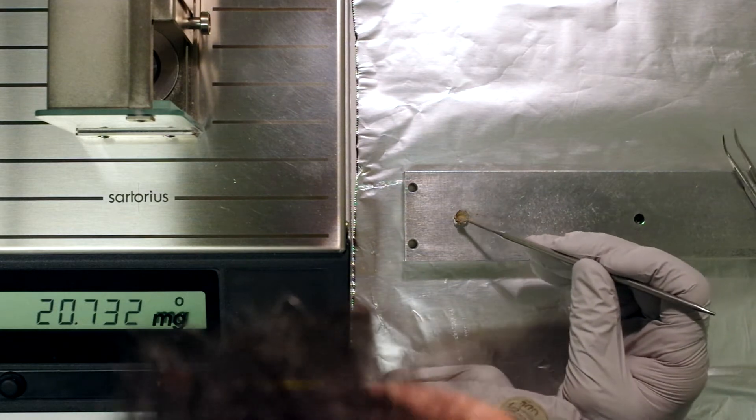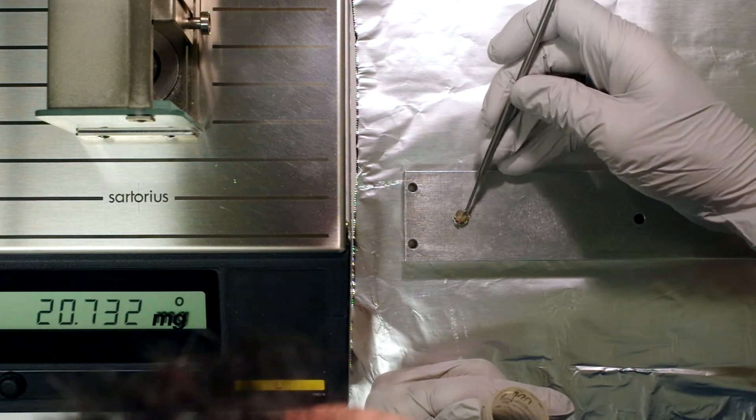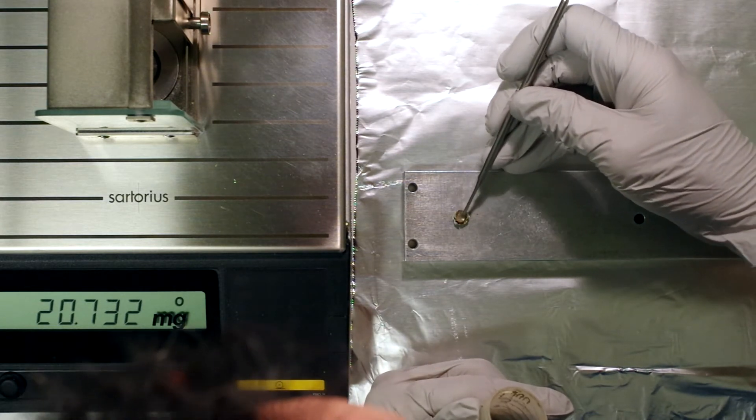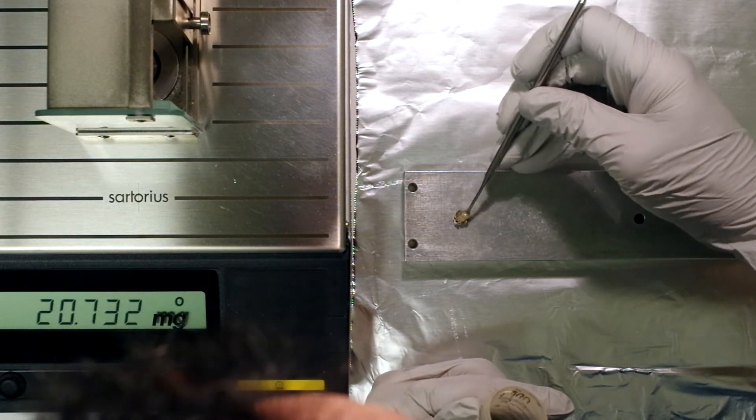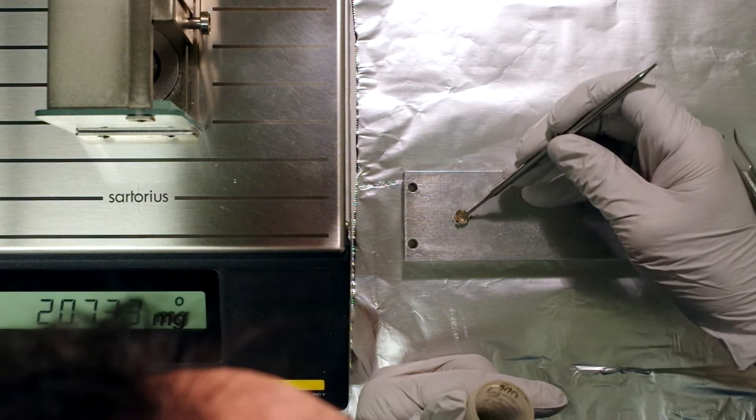I'm getting a little bit of soil on the tray. If I was doing this for a real sample, I'd be a little bit more careful. But as long as you're careful not to contaminate other samples or the outside of the capsule, you should be alright.